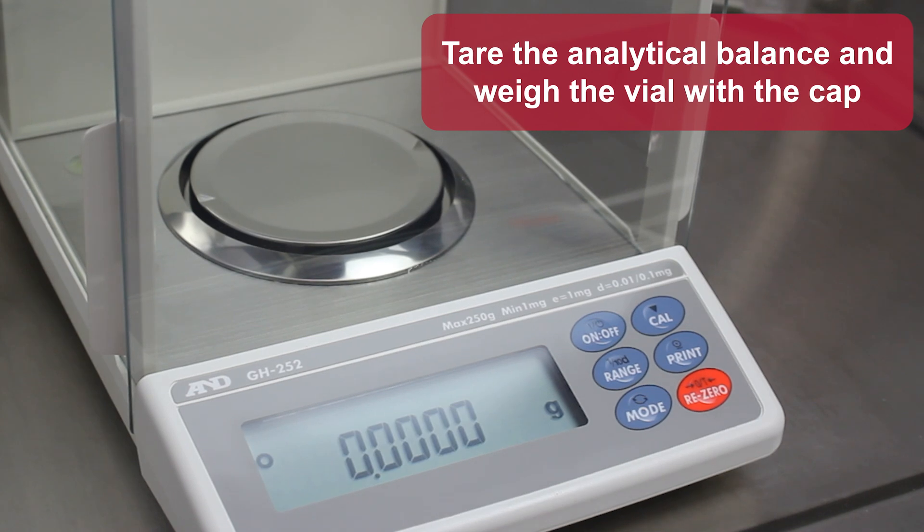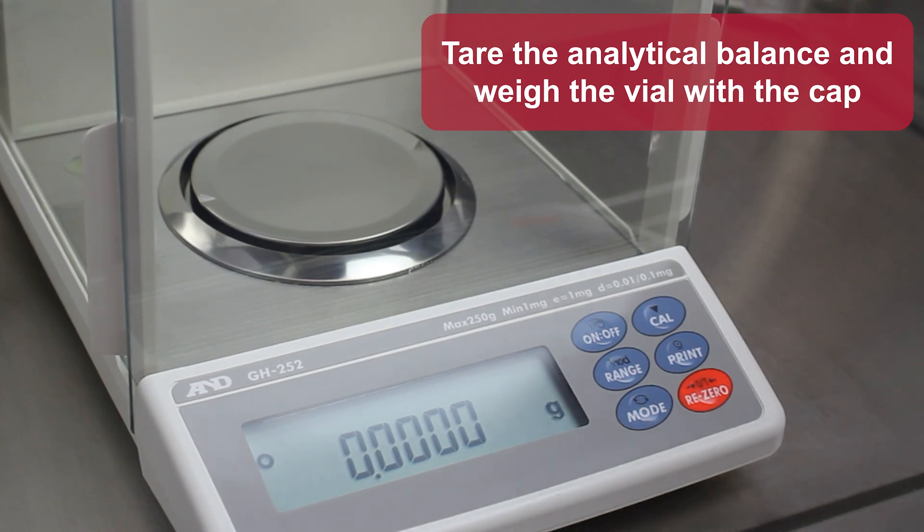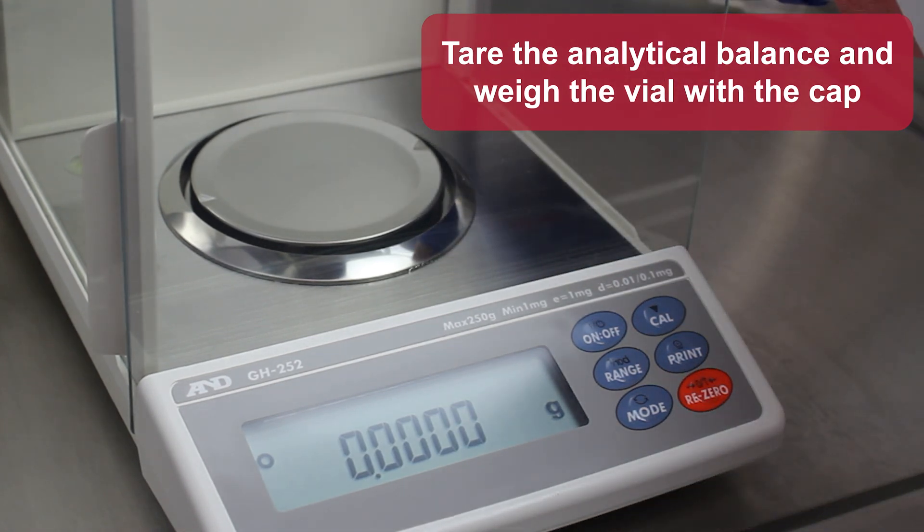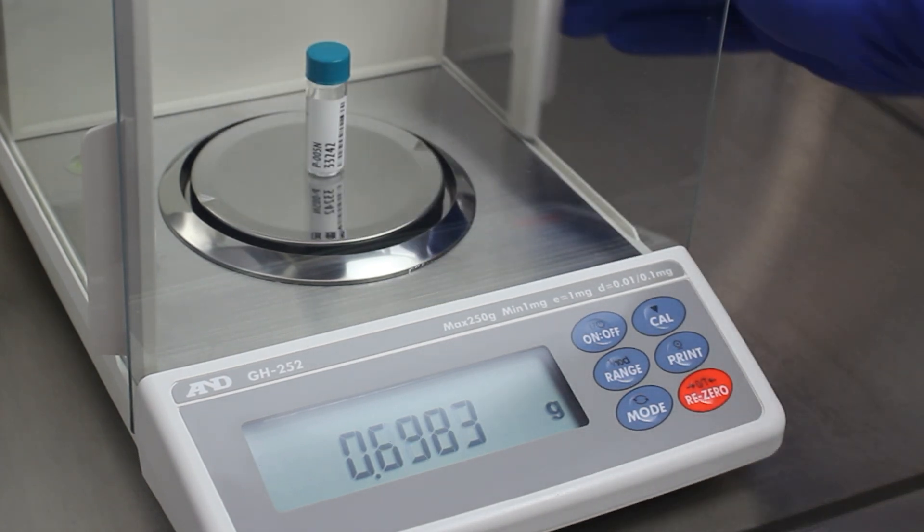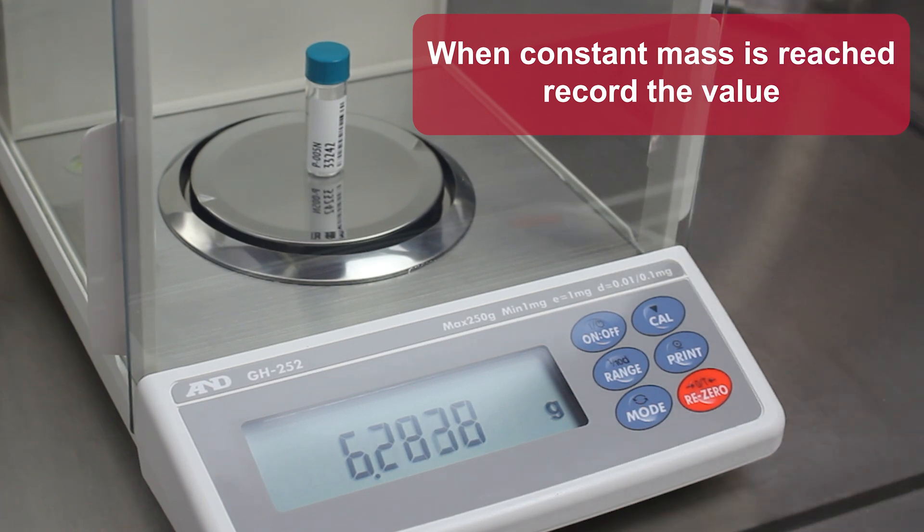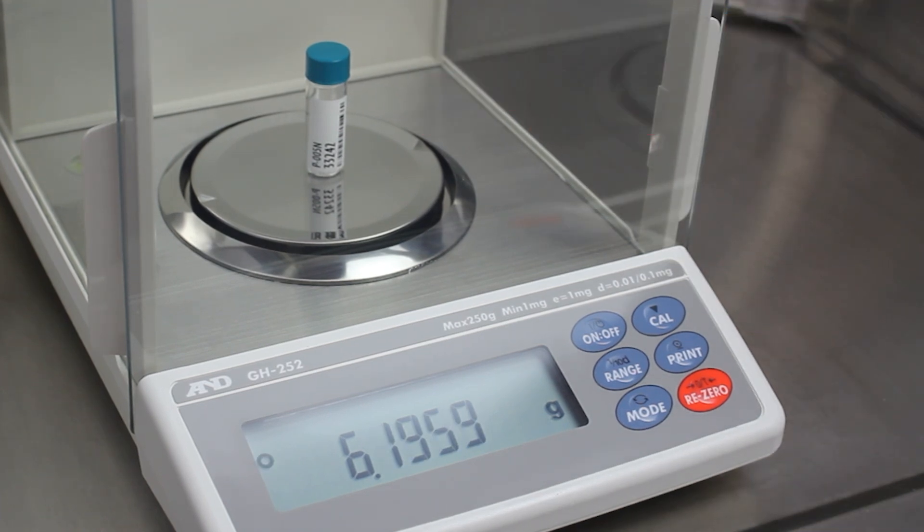Tare the analytical balance and weigh the vial with the cap. When constant mass is reached, record the value. Here is the initial value.